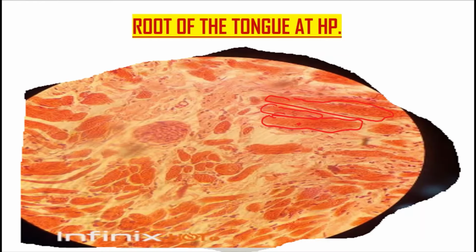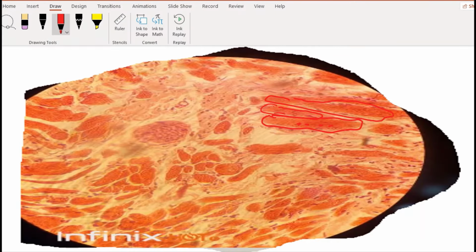There's a nucleus here, a nucleus here, a nucleus here. That's what you notice in these muscles, so we say that skeletal muscle is multinucleated.